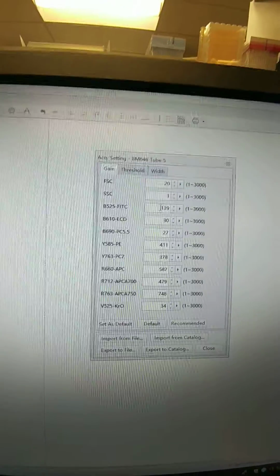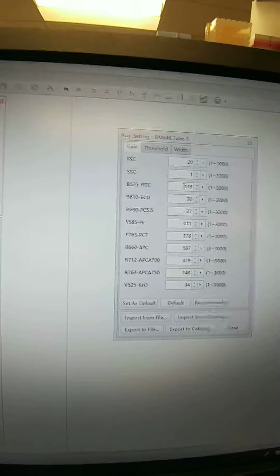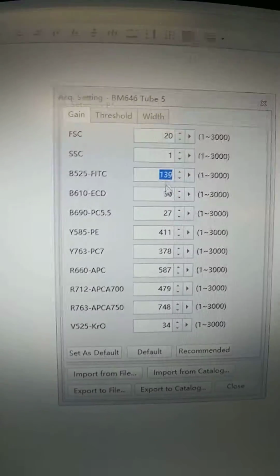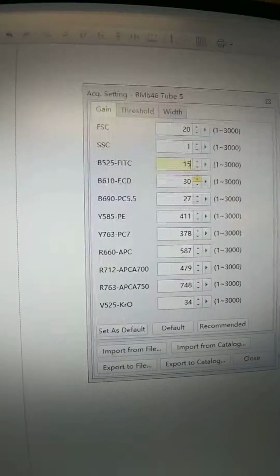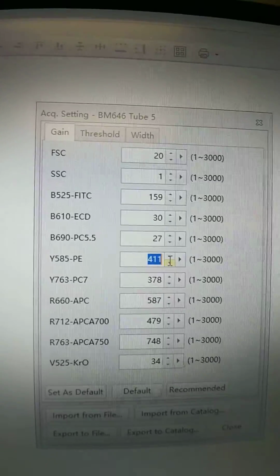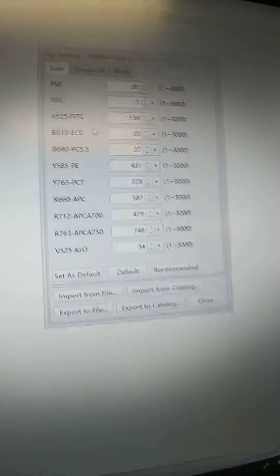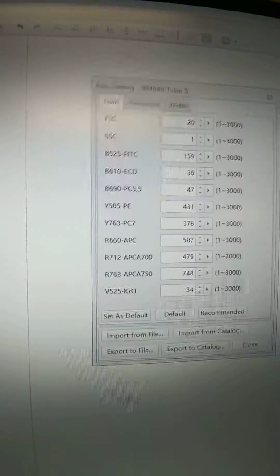I know Steve would like to see, at least in one instance, the FITC, PE, and PC5.5 gains increased some. So we're going to increase those 3. Let's start by 20. So we'll highlight this and change it from 139 for the FITC to, let's go to 159. Okay, for the PE, you're at 411, so let's try 431. And the PC 5.5 was at 27, so let's try 47.